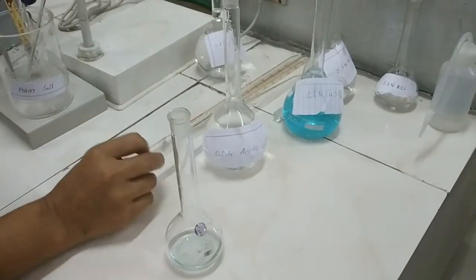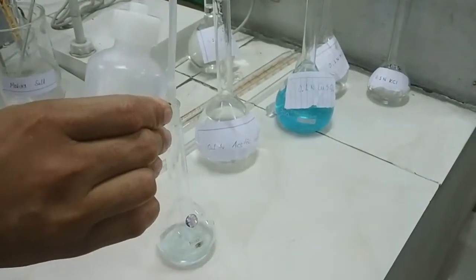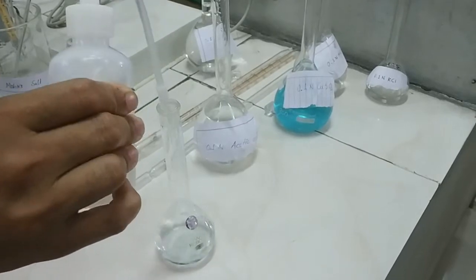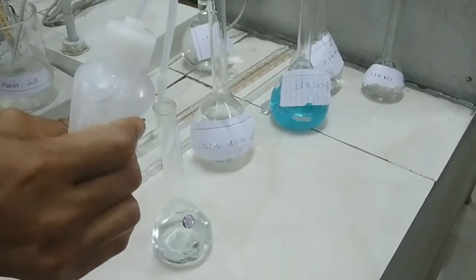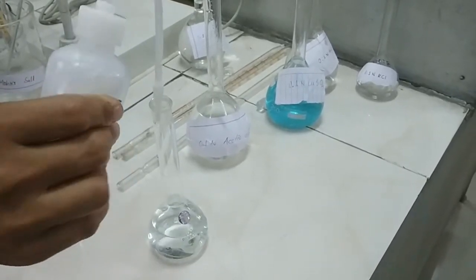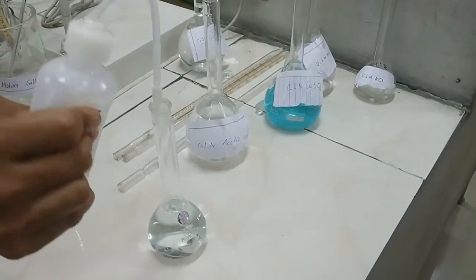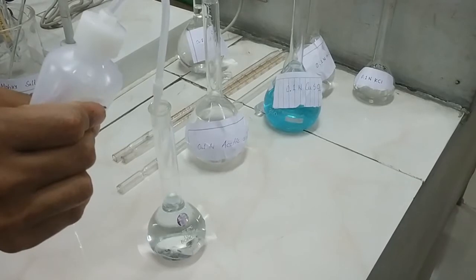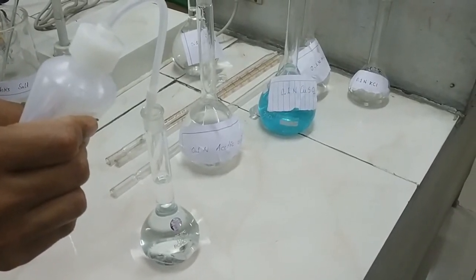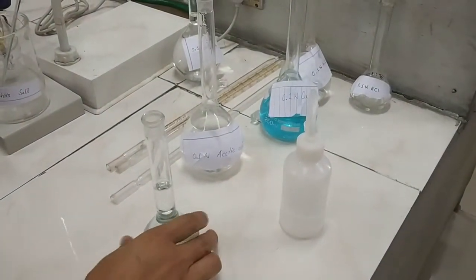Now, we have to add 85 ml of distilled water to this mixture. Here we have added 85 ml of distilled water.